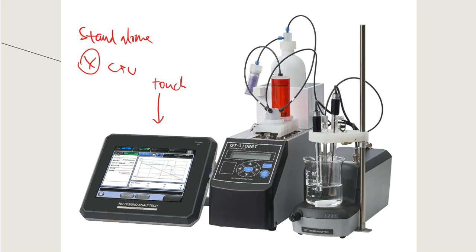This is like the substitute for the computer and for the software on what I would call fancier versions of an automated titrator. Next up, we have the burette system, and the burette system will come in different sizes, and they will often be the center of the titrator. They can range anywhere from 10 mL or 20 mL or 50 mL or 100 mL burette sizes. And these will get filled with the titrant that you want to use for your lab procedure. And that titrant will often come from a bottle that's connected to it, and very often it is nearby, if not directly behind the burette.